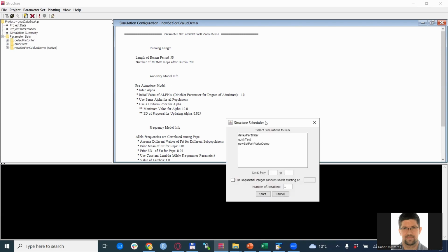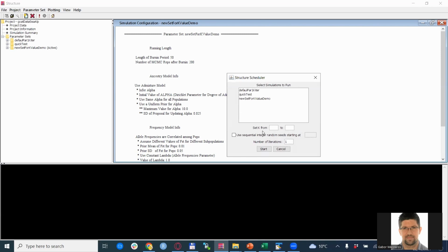This opens a smaller window where you can set a number of K values from-to and also the number of iterations. Also, you can set the so-called starting seed numbers. This is very useful if you want to exactly replicate some runs, but for us, this is not important right now. You need to select the parameter set to use, so we will use the new one that we have just created. Let's say we start from K equals 1 to, let's say, K equals 5, and we will do, let's say, 5 iterations each.